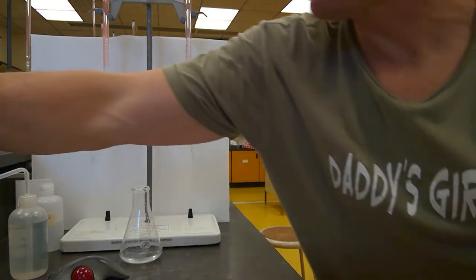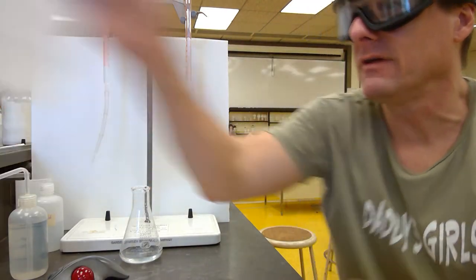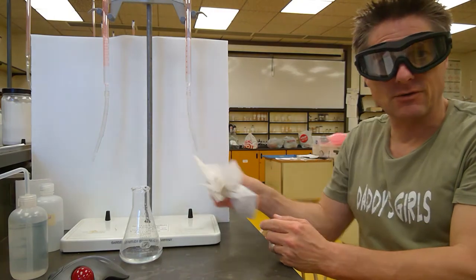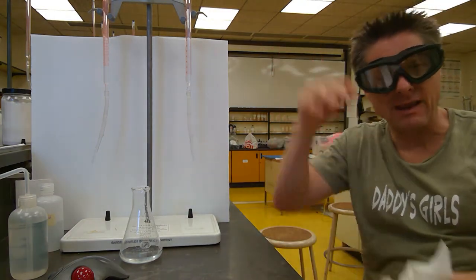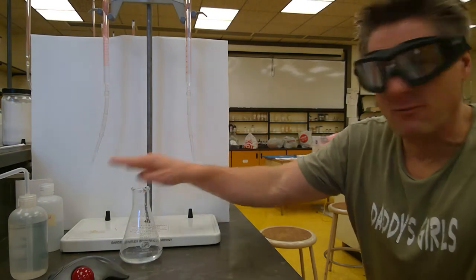And usually I'll dry that off, just in case. I don't want any drops of liquid on the outside. So when you pour it in, sometimes you spill a little bit. Make sure it's dry on the outside. So we're nice and flush at the tip for both of those.